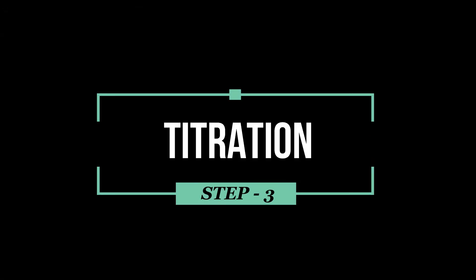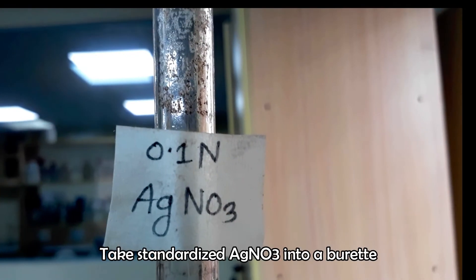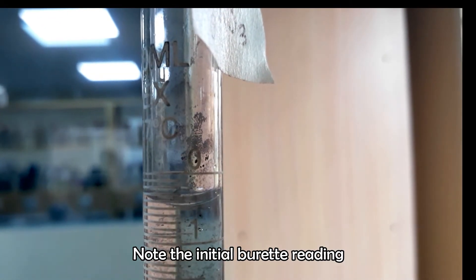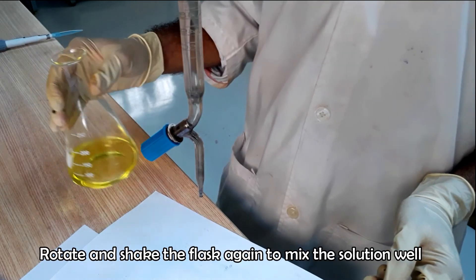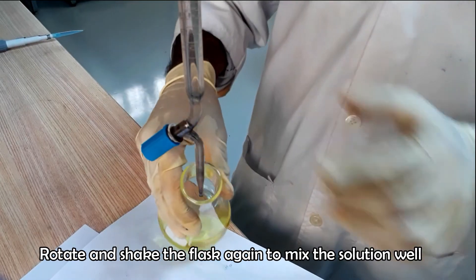Now we are ready to do the titration. Take standardized silver nitrate into a burette and take the initial burette reading. Now start titration.